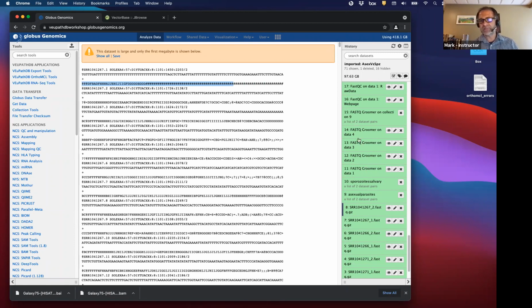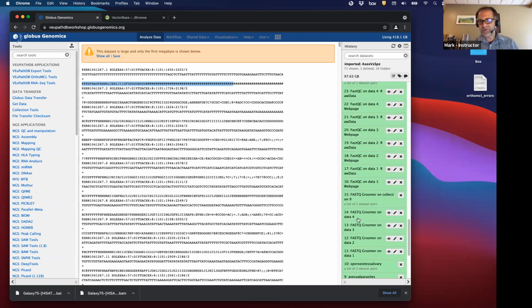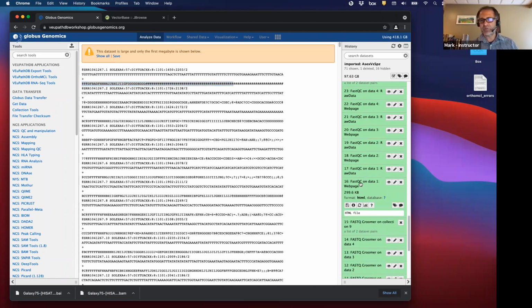Basically all it does is make sure it's in the right format. And so, FastQ Groomer is a nice tool. FastQC is another tool that's really helpful, and it's useful to look at the output of that tool. That's what it's for, looking at the output.